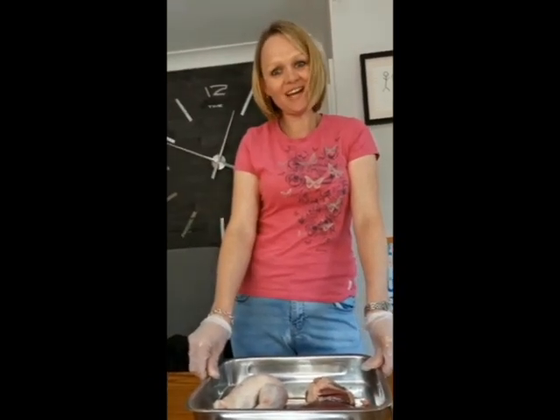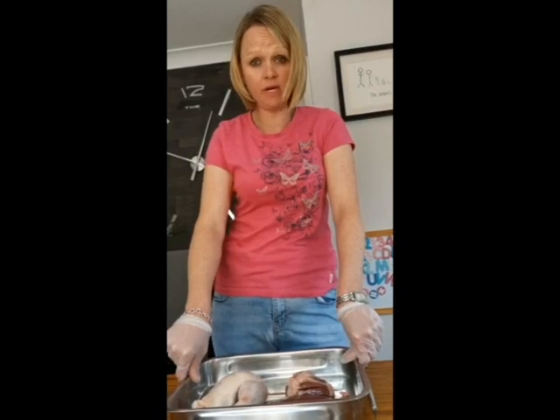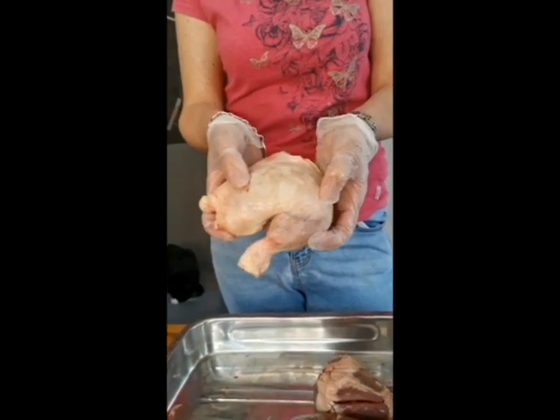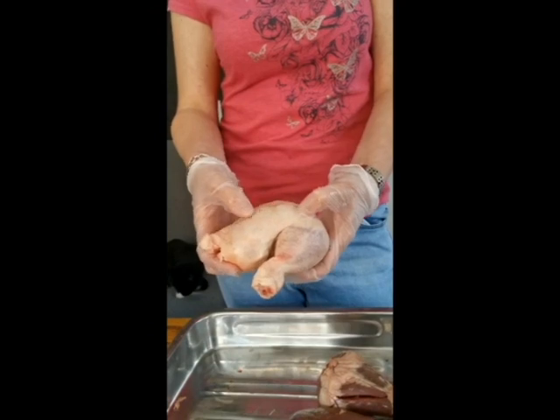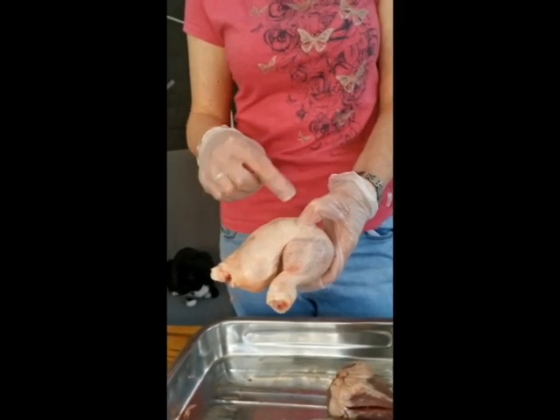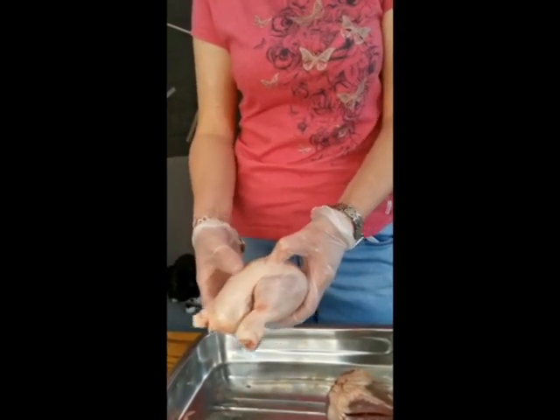Guys, right, in my tray I've got a few things that I'm going to be dissecting with you. I'll do them one at a time, but for now I'm just going to show you what I've got. So the first thing I've got is a chicken leg. At the end of the day, a lot of us will probably eat chicken legs unless you're a vegetarian, but what I wanted to do is dissect it open properly so you can see the cartilage, the ligaments and the tendons, and how this leg actually coordinates the movement.